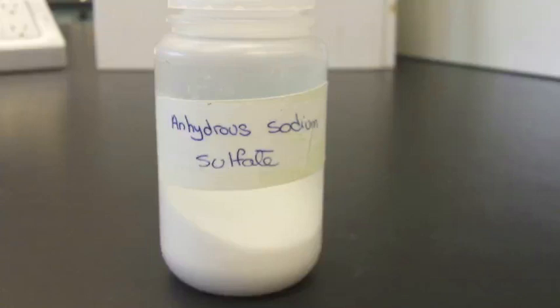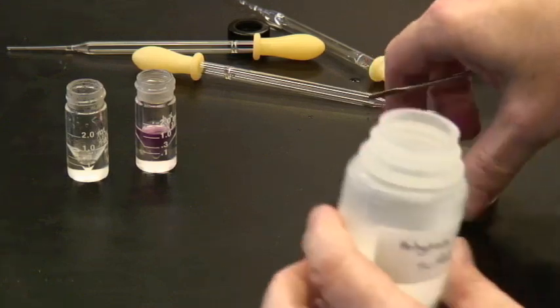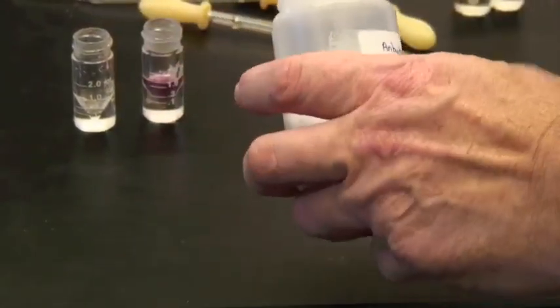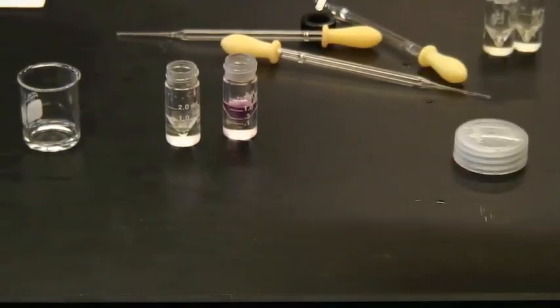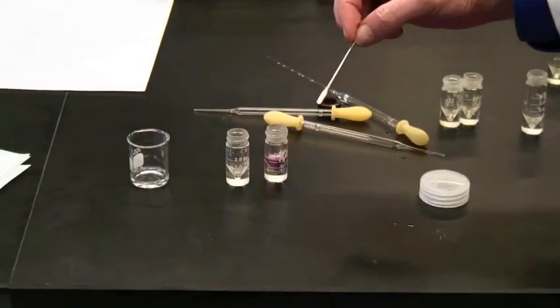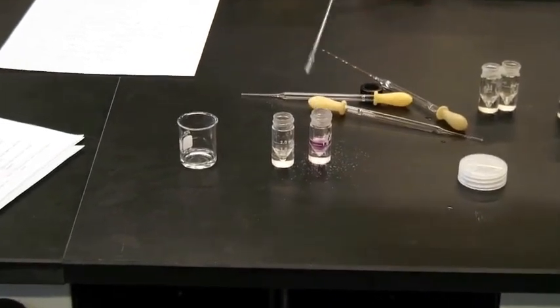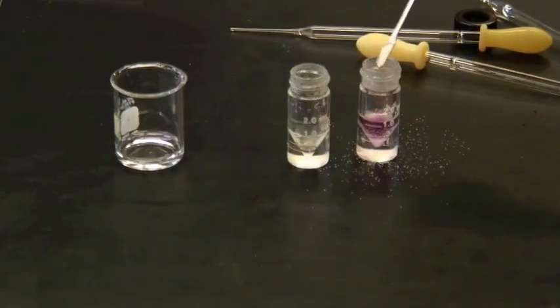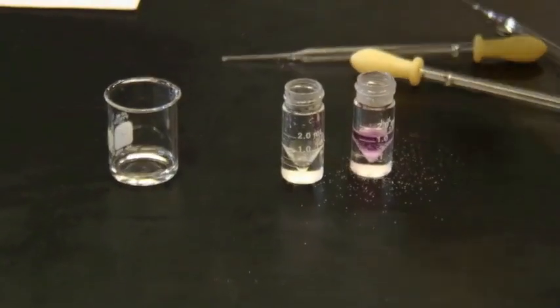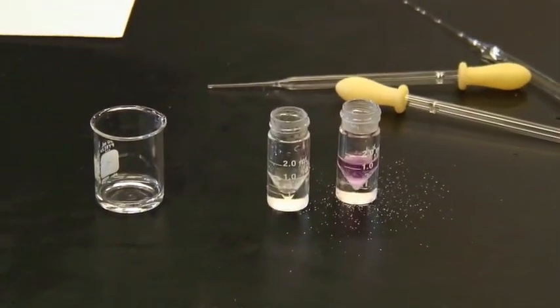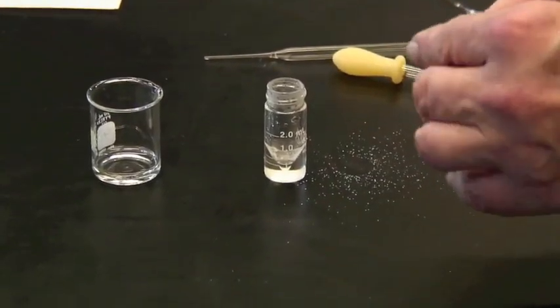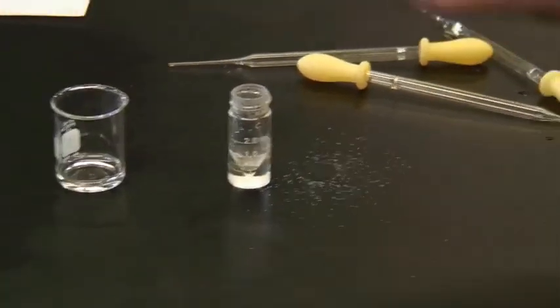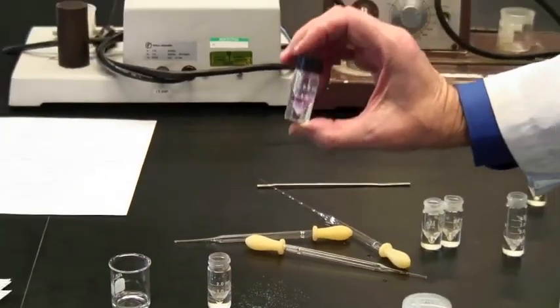You now need to use some drying agent. Here it is, anhydrous sodium sulfate. And use about the end of your scoop spatula. About that much to start off with. Drop that in, preferably without spraying it on the countertop. Maybe a little bit more here. And again, put the cap on and swirl. The drying agent will not take effect immediately. It does take a few minutes for this. So put that like that, shake it up, and let it sit for a few minutes.